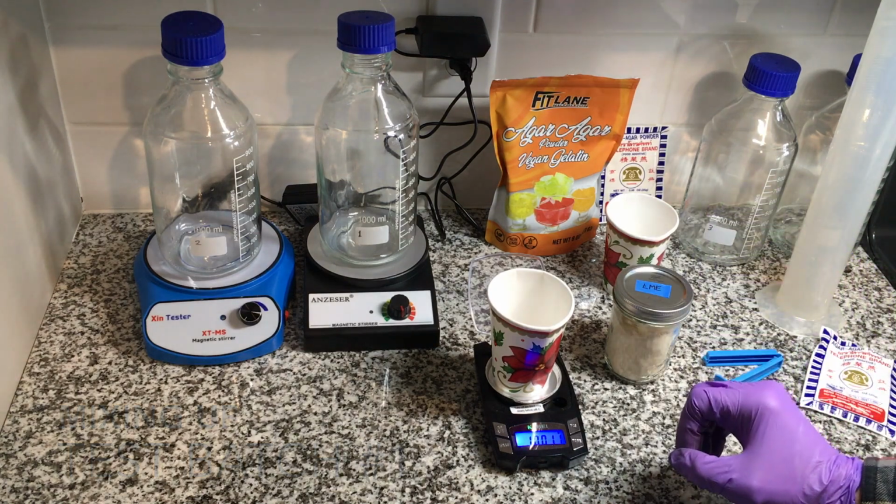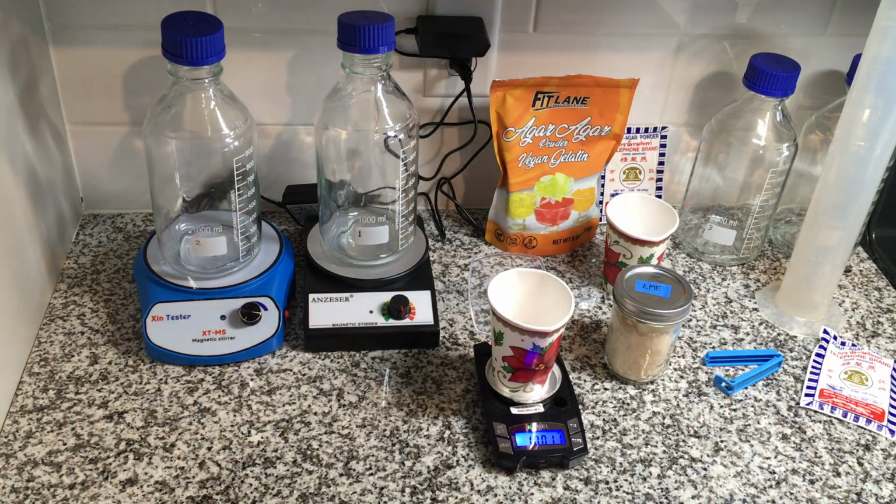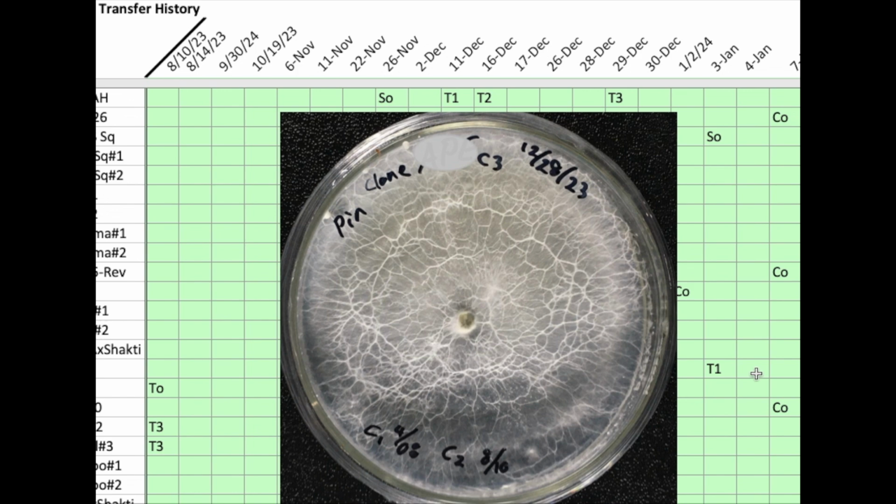And now it's 6 months later, so I'll try and recreate events as best I remember them while editing this video together. I tried to find out if there was a date when things stopped growing, and one of the sources of information I had was the labeling on my petri dishes. So this example may not be proper, but I'd been tracking all the transfers. A clone was created in April, and then it was transferred once in August, third transfer in December.